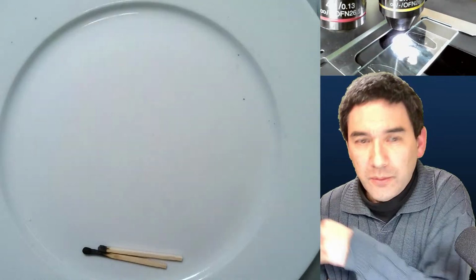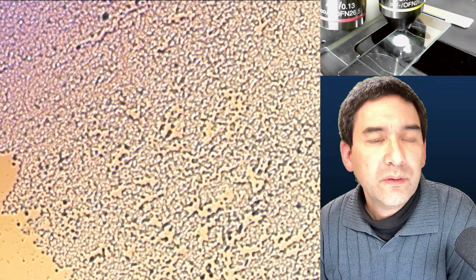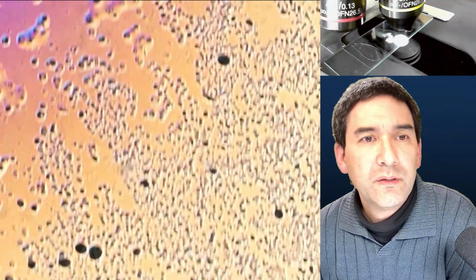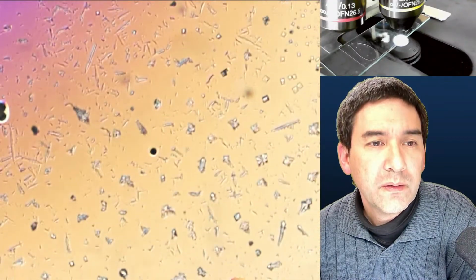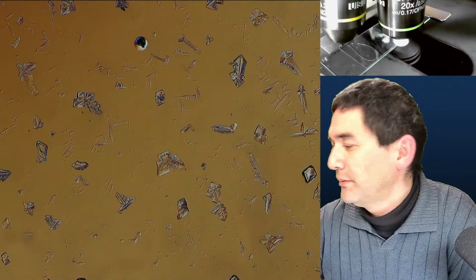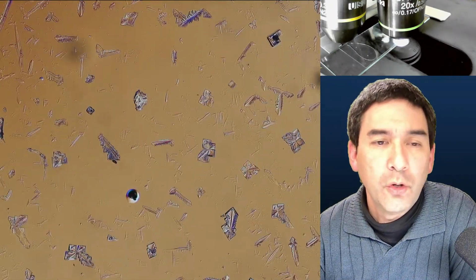So here we go again with the, again, a little bit too intense. And then we have to find it again, usually somewhere on the side. We're able to find the crystals again, hopefully. Yeah, if I find them. I don't know where they are. So here, yeah, here they start. Here they start again. Okay. And we go up with the magnification. I don't know, it could be also sulfur or phosphorus or a combination of different substances.